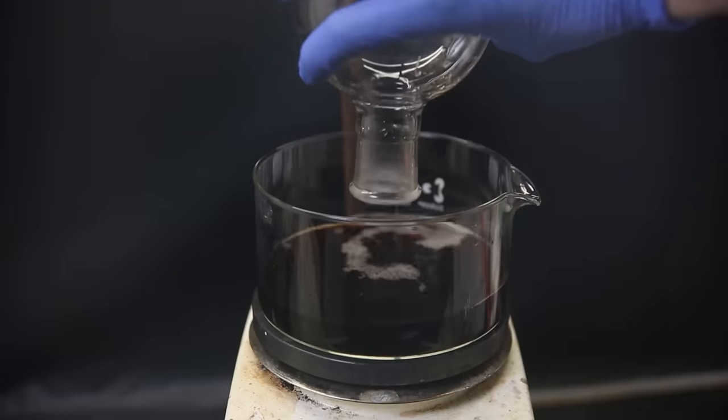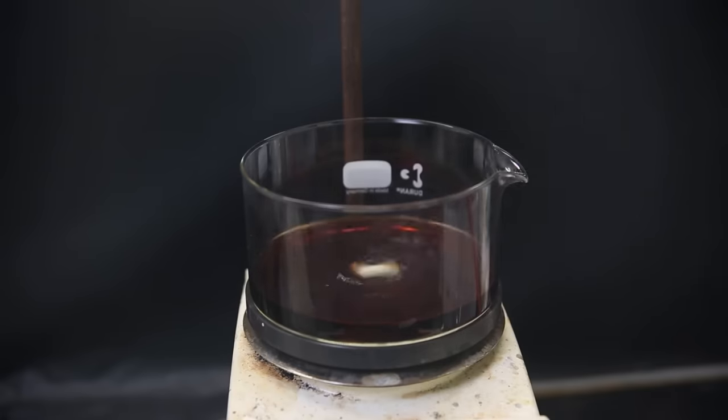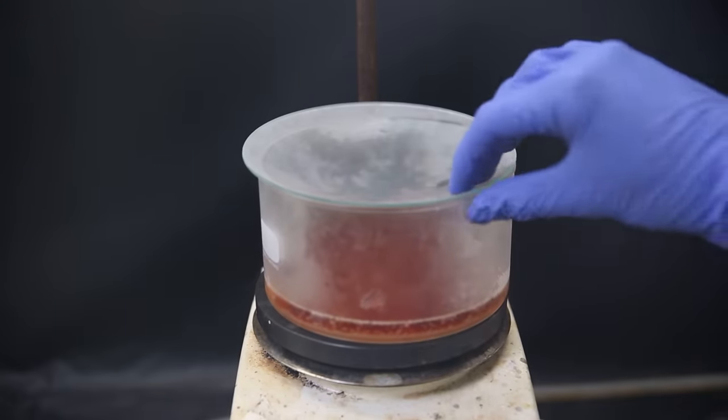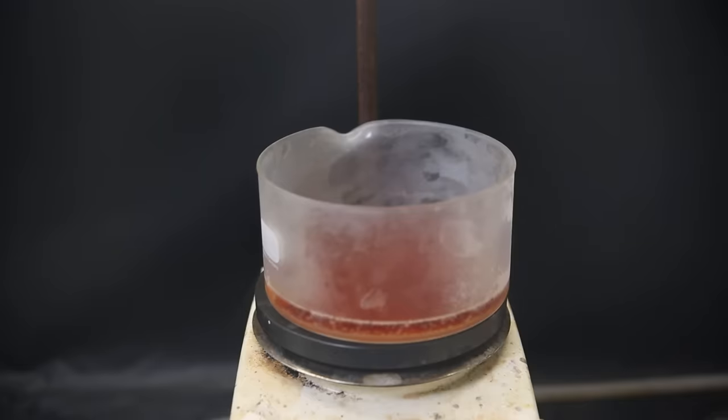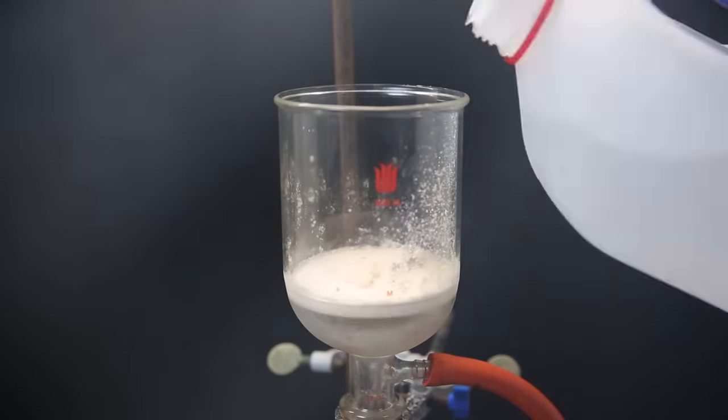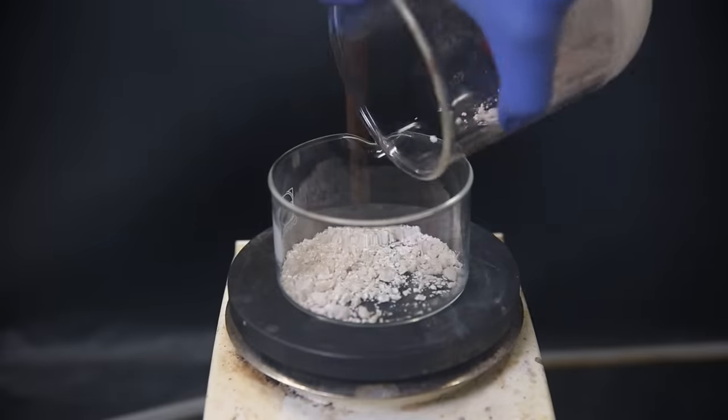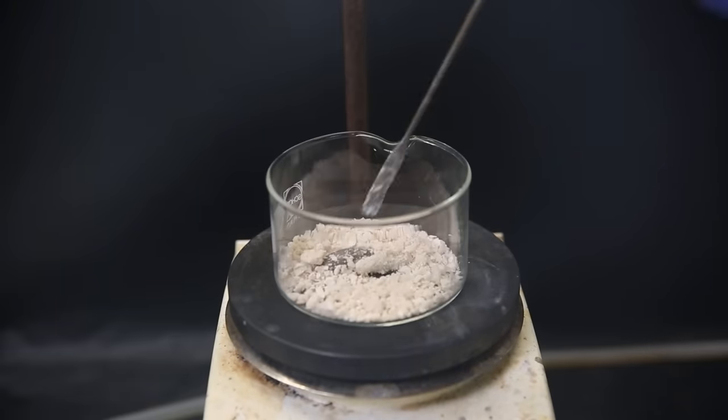But I feel like a bunch of it dissolved away in the methanol, so I will first take the filtrate and boil off half of the solvent and then put it in the freezer instead of the fridge at -25°C. A bunch more solid crystallized out. I filter that as well and wash it with a bit of methanol. This part is a bit more colored than the other part, but it's not that bad.